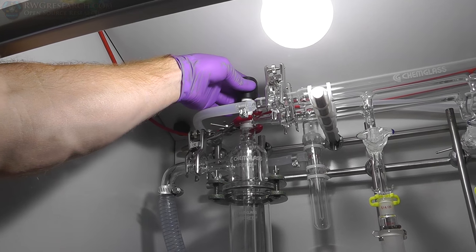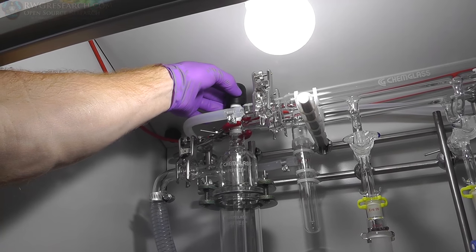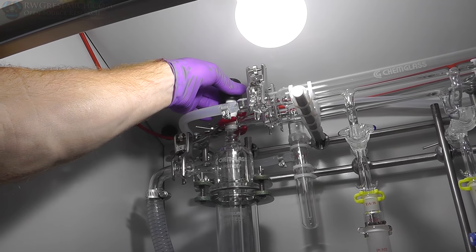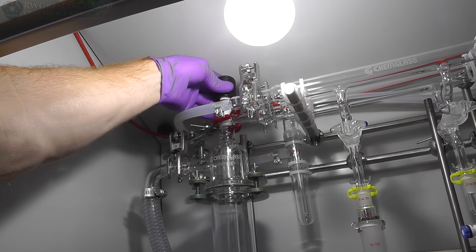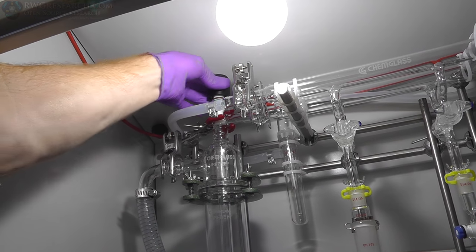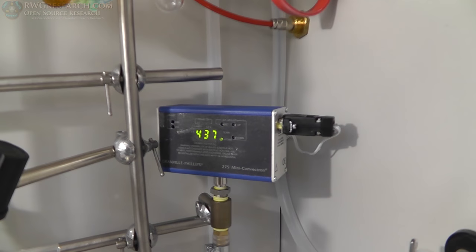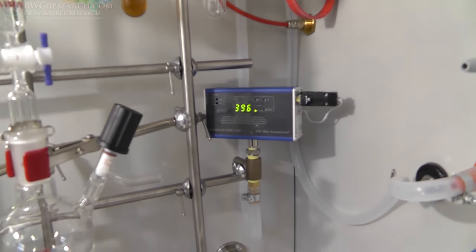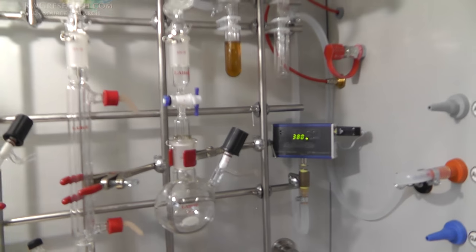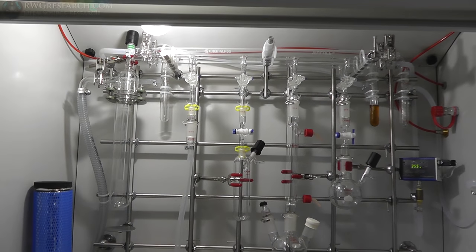Looks like that's holding steady, so let's slowly crack open this guy. Make sure everything else is closed, everything else looks good. There we go. Now, I do not have this gauge calibrated, but it states 400 and it's going below 400 millitorr. So that's a pretty good vac. So we'll let this sit for a few minutes and see how low it goes, and then we'll shut this off and see if it holds.